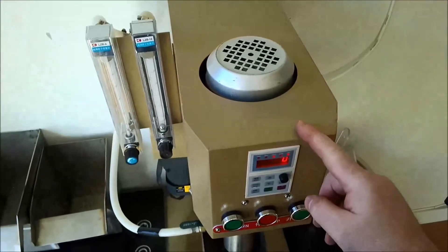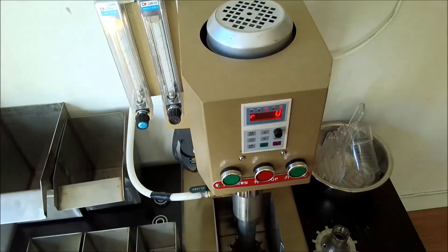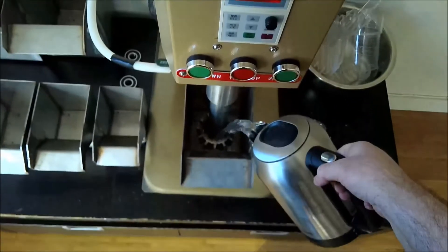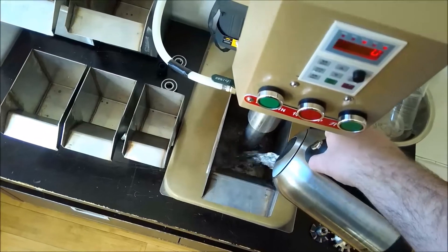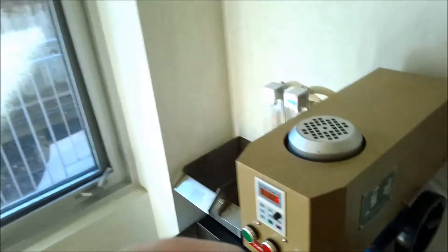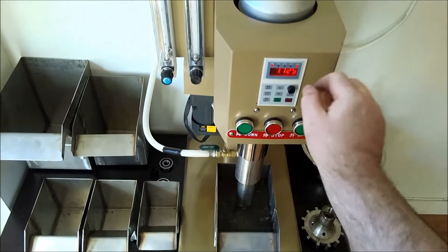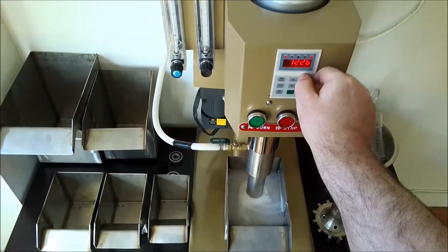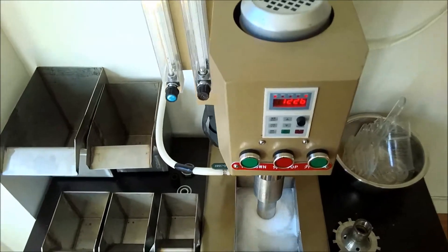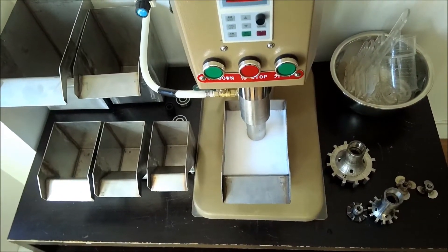All right, so I'll just fill this up with water and detergent and see. That'll be my fake frother for today. Okay, start. I don't want to get the air on. There you go.